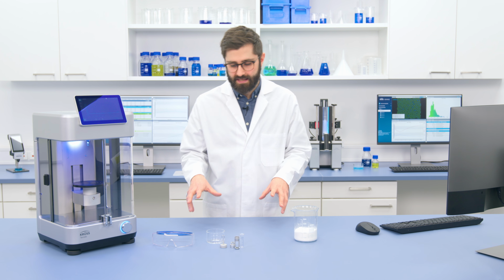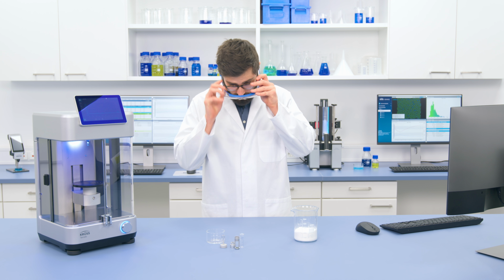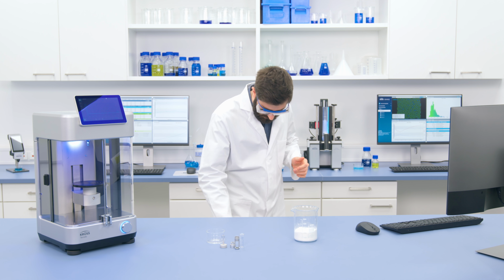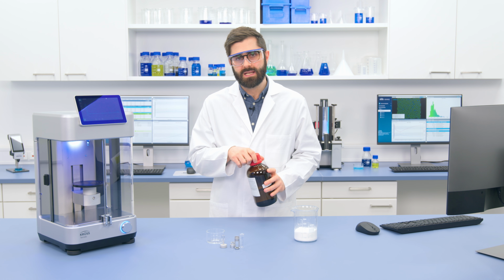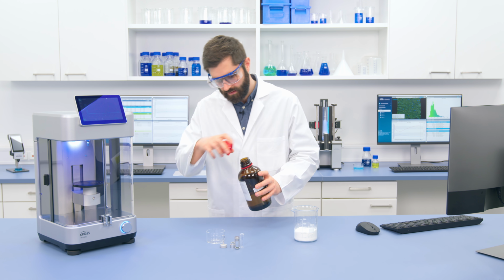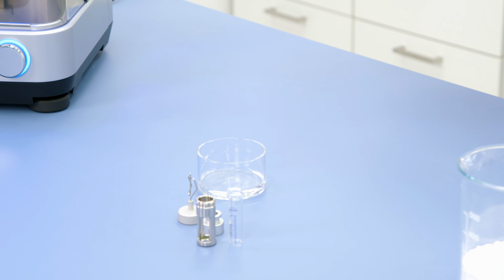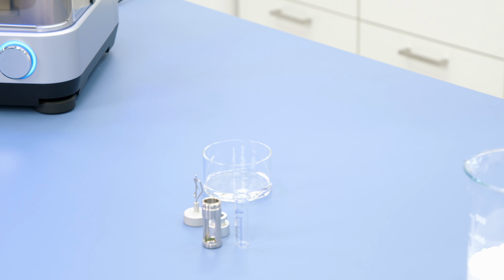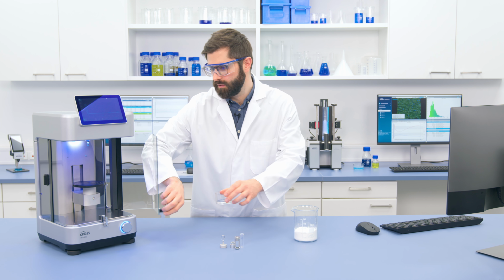So now that we're back at Tensíío, we can start by putting the liquid into a sample vessel. So I've got my ethanol here. And in this case, we actually don't need very much liquid. We just need enough to saturate the powder. So I can just pour some in. And I can place this now on the sample stage of Tensíío.